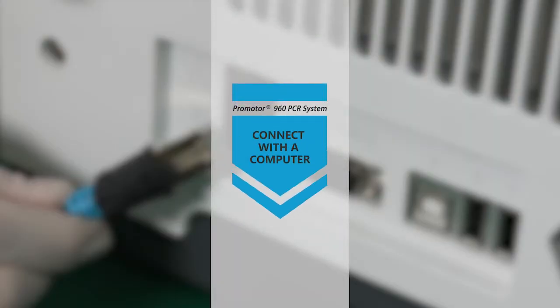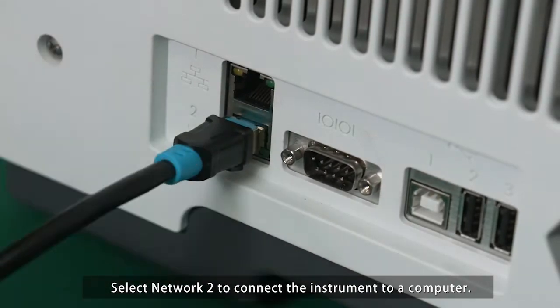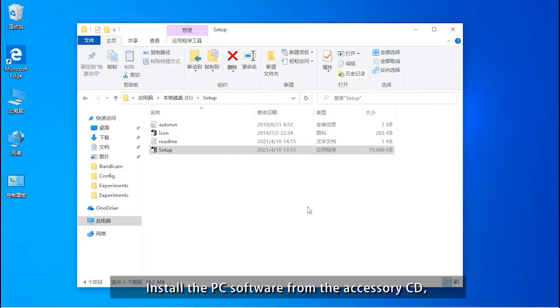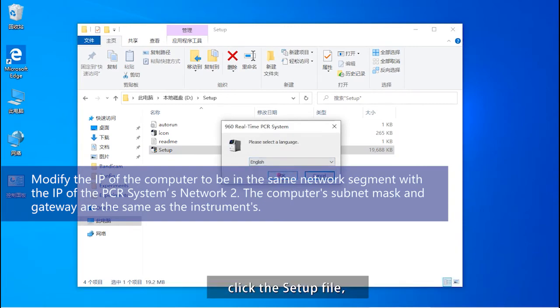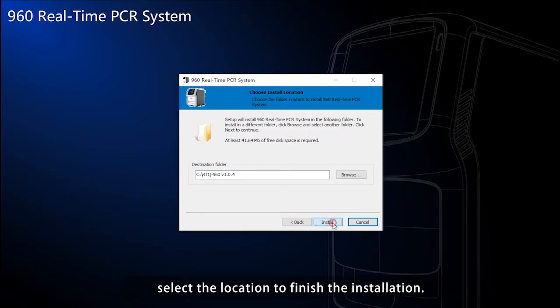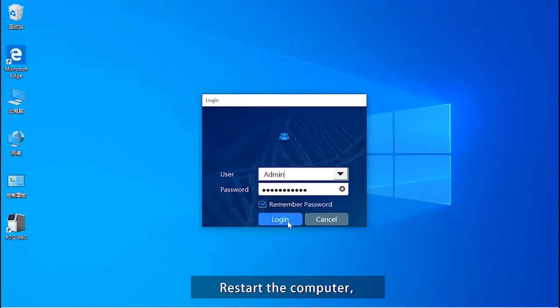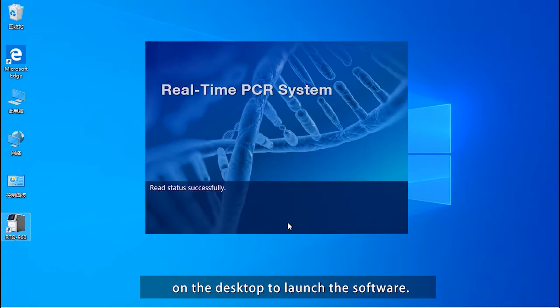Connect with a computer. Select Network 2 to connect the instrument to a computer. Install the PC software from the accessory CD. Click the Setup file. Enter the password. Select the location to finish the installation. Restart the computer. Then double-click the 960 real-time PCR system icon on the desktop to launch the software.